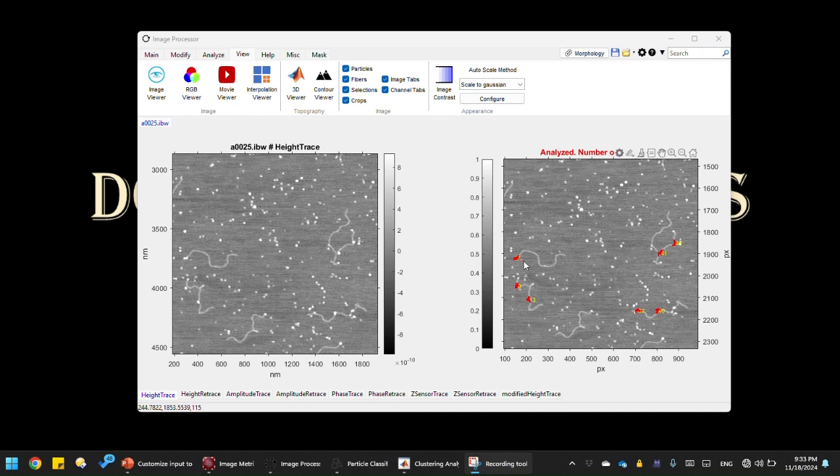And I'm only showing you a part of the image, not the whole. As you see, I already have the protein DNA complexes masked. This is done through an automated script feature by using mask morphology. I discussed that in another video, so I'm not going to go through that process. I already have the protein DNA complexes masked here, so I'm going to go directly to particle classification.